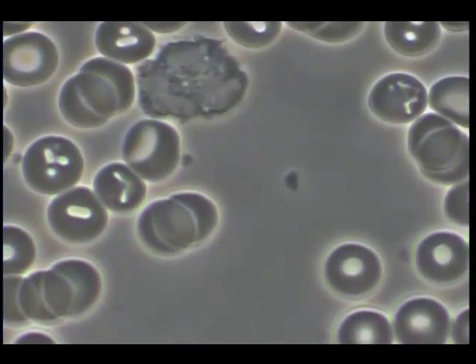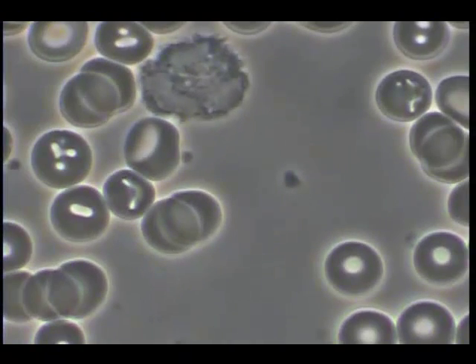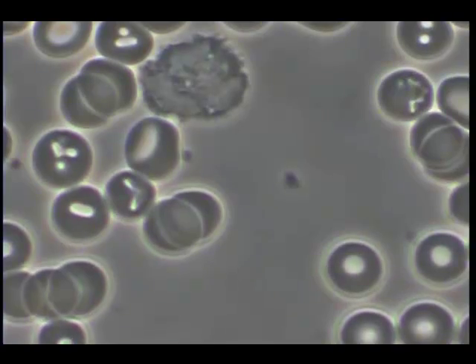Here's another artifact that appears to have an extension. Normal platelets don't have things like this sticking out, so if it is a platelet, it's pathogenic. I'm unsure what kind it is, but I also observe in the background all of this particulate, suggesting that the serum is quite cloudy with some unknown category of material.